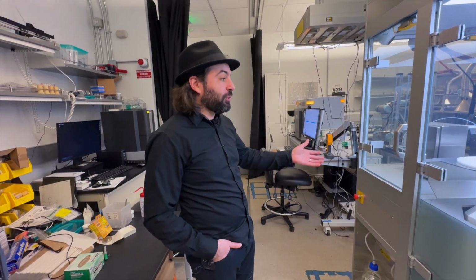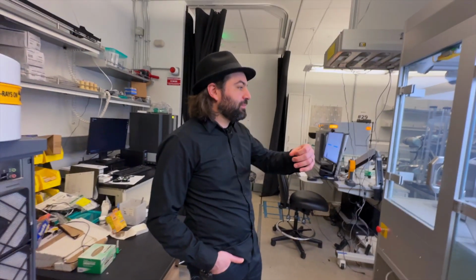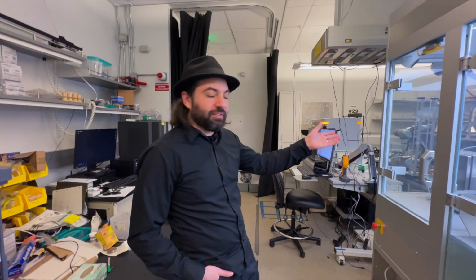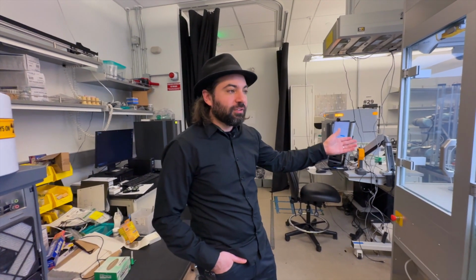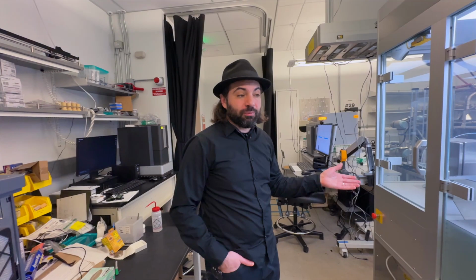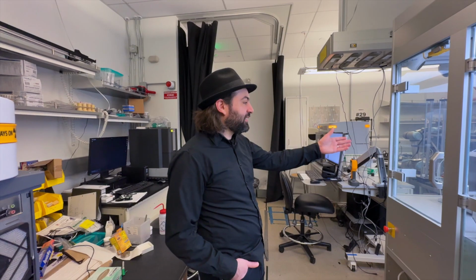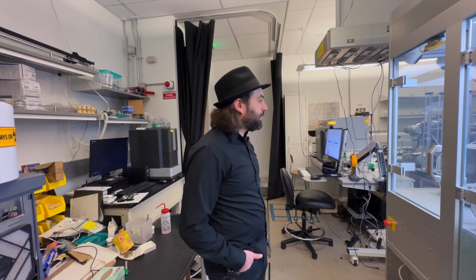Of course we would like everything to look this way, but the lab is growing, right? So then we have many. For example, another example I can give is the tube furnace itself. MTI made those tube furnaces for us. We said we need something like this, and they said, okay, challenge accepted. Then later they got the tube furnaces for us.